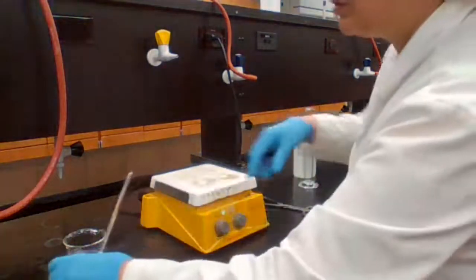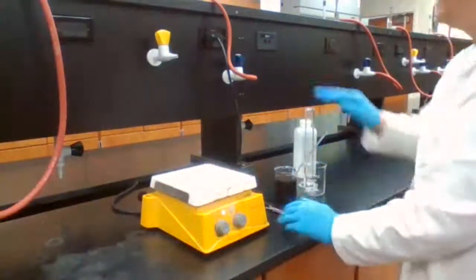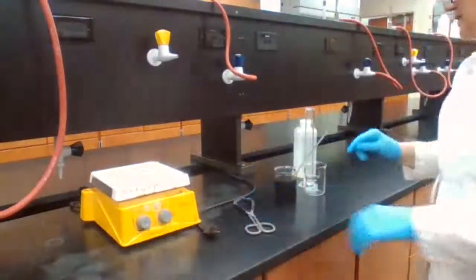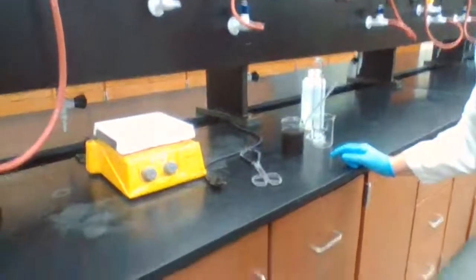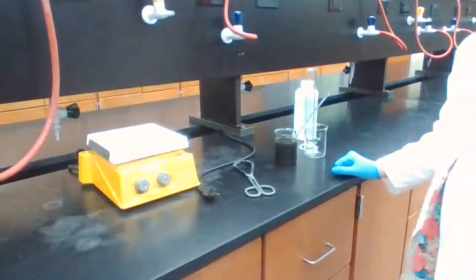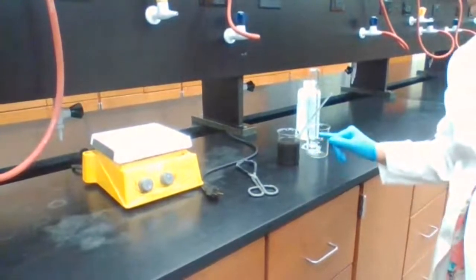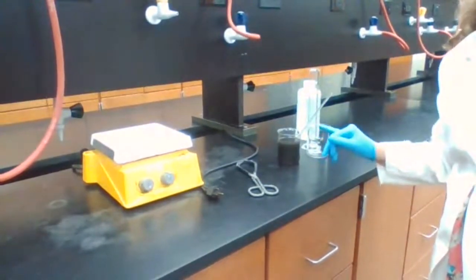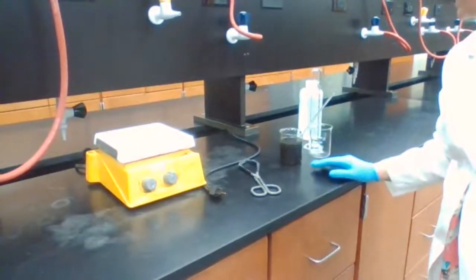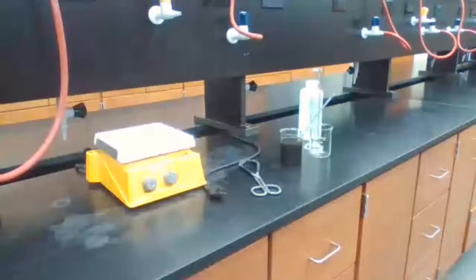And we have to allow to cool, not just cool. Also, it needs to settle down. And when it does settle down, we can take the clear liquid, transfer to another beaker. So I'm just going to wait for that part. While this one is settling down, I'm going to measure the 25 milliliter of 3 molar sulfuric acid you told me. I will bring it here to the station while this is settling down so I could use the time efficiently.